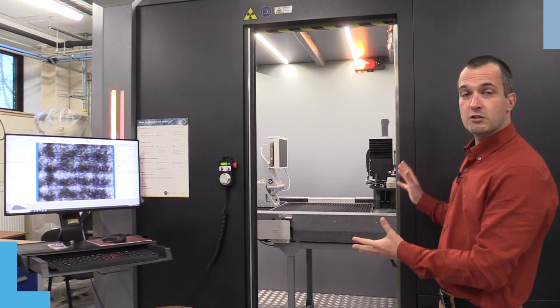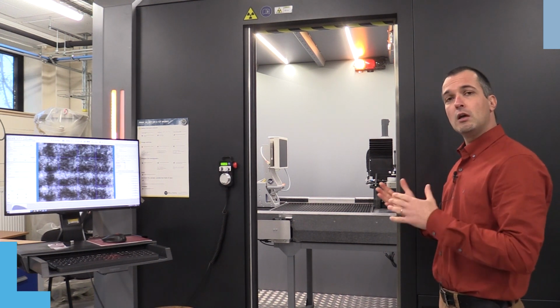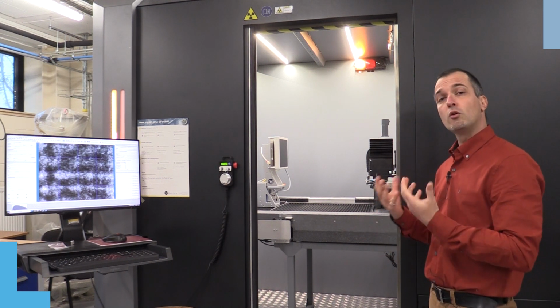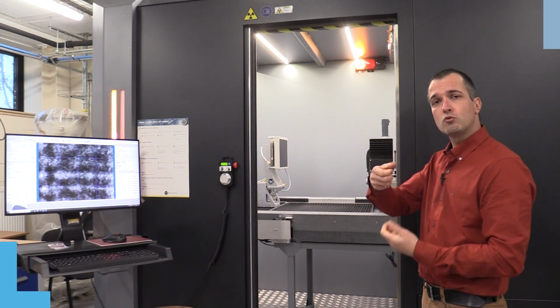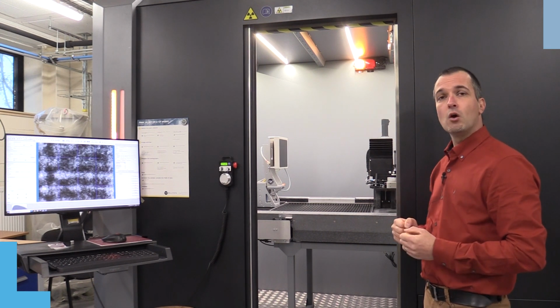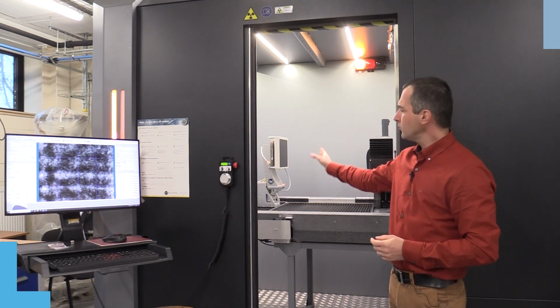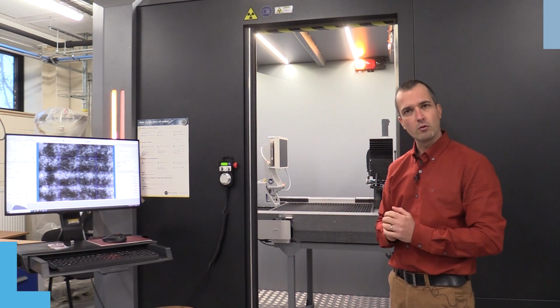We have a second X-ray tomograph or CT scan. This one is also from the brand RX Solutions, but this is the XL model. The XL model has the interest that it's a bigger chamber, so we can look at bigger samples, but we can also realize in situ experiments, typically pulling on samples to measure their characteristics while under force, or heating the sample in situ. This tool is also interesting because it has two types of detector, a flat panel, but also a CCD camera, allowing us to have better resolution.